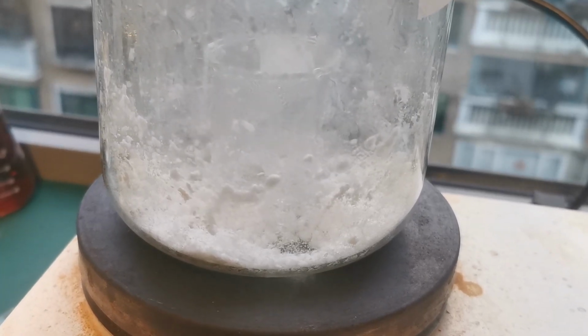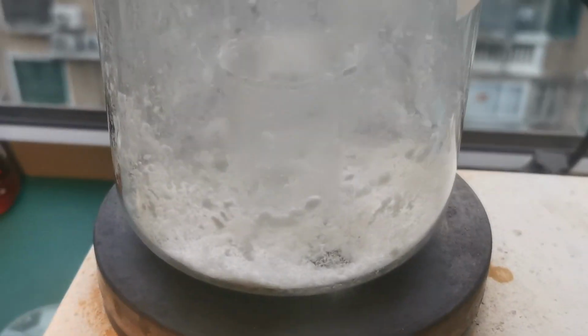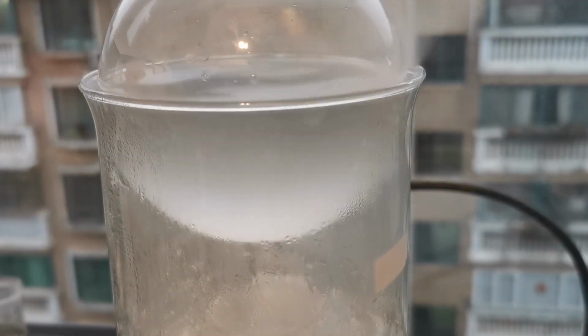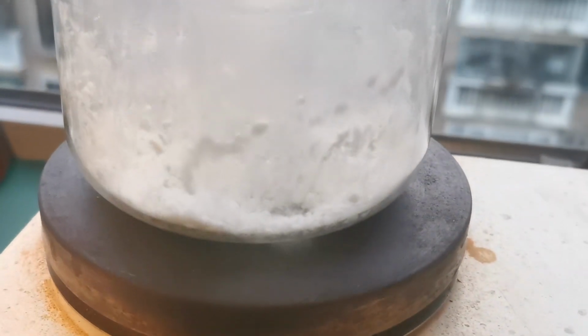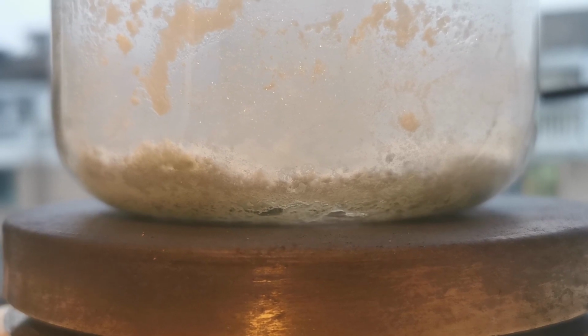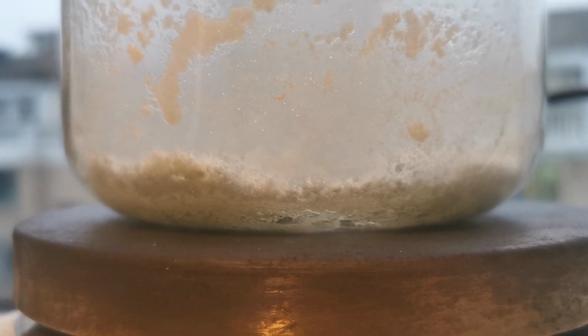The phthalic acid starts to dehydrate and form phthalic anhydride, which sublimes and releases out of the beaker along with the remaining water vapor. I placed a flask of cold water above the large beaker to allow the phthalic anhydride to cool down and deposit. Soon, the phthalic acid starts to melt slowly. It actually decomposes around its melting point, but we still need to melt it completely.